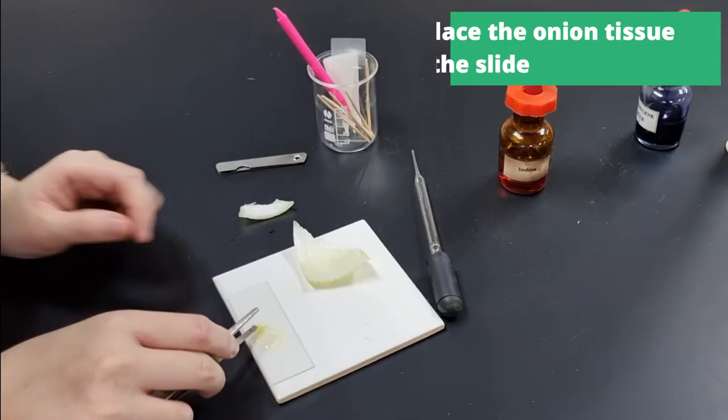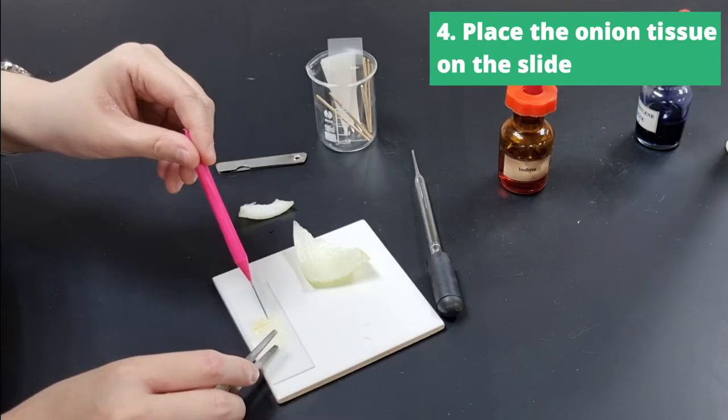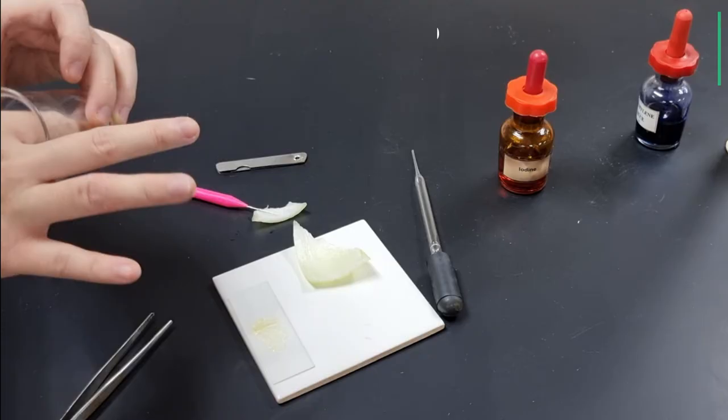We're going to place that on the iodine solution right there. Now if it's curled a little bit, don't worry, it usually flattens out once it touches the iodine drop.